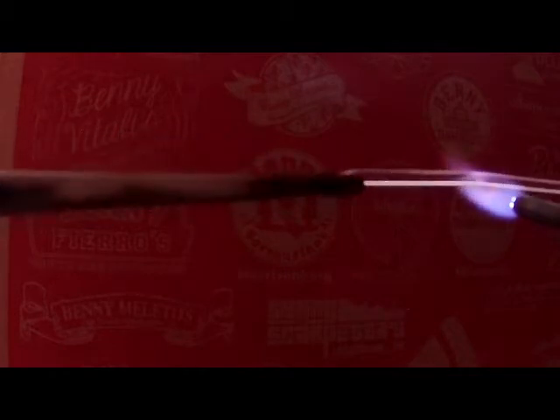Earlier this week, when I was speaking with one of our professors at Radford, he asked me if I could make a sample holder for some of the research that he's doing. And he had some material, metal, that could have been used, but the issue is making that sample holder out of a metal could cause contamination. And so I started playing around with some ideas for the design and how to get it done using borosilicate rod.